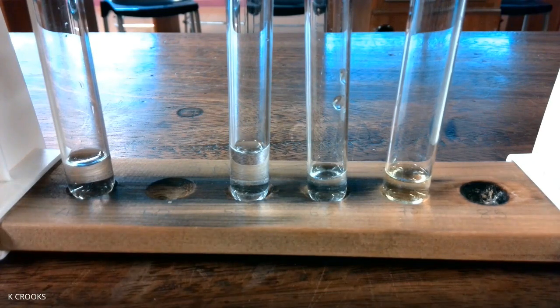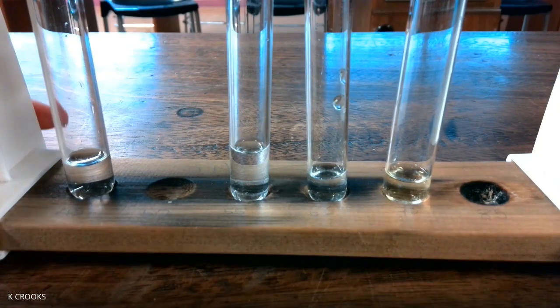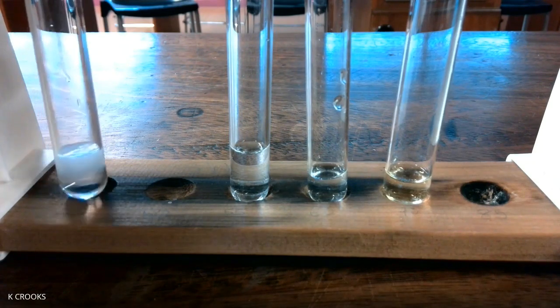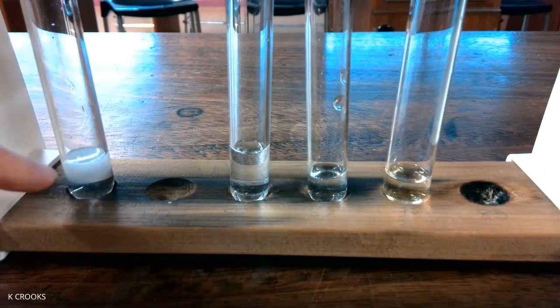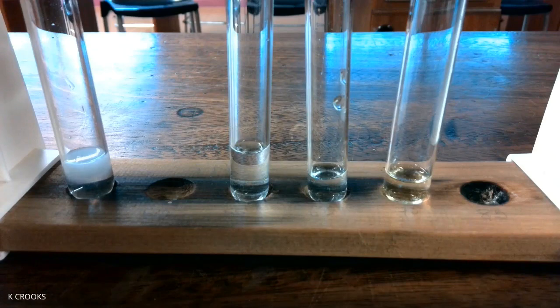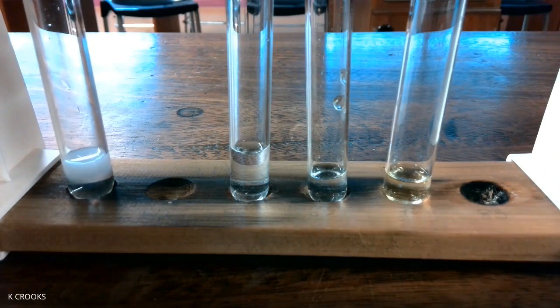And we identify sulfate ions by adding barium chloride solution. And the word solution is important. We don't just say barium chloride. It's barium chloride solution. And I just add some barium chloride solution to it. You'll see you get a white precipitate. And the name of this white precipitate is barium sulfate. Okay, so that's the test for sulfate ions, barium chloride solution.